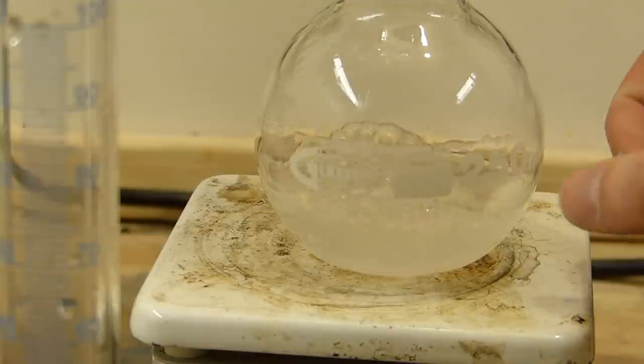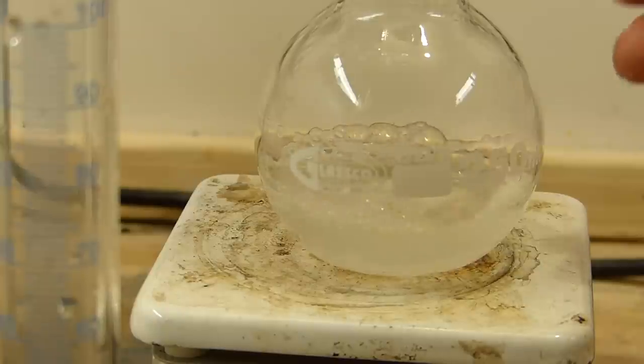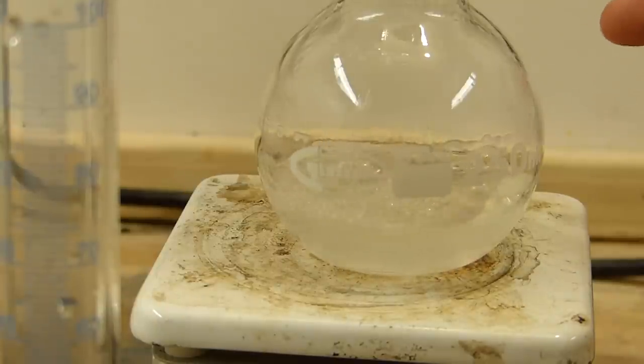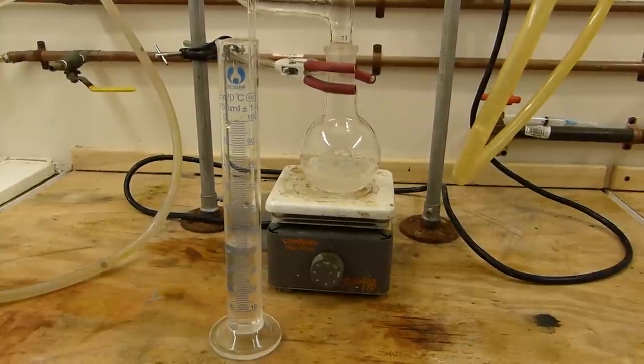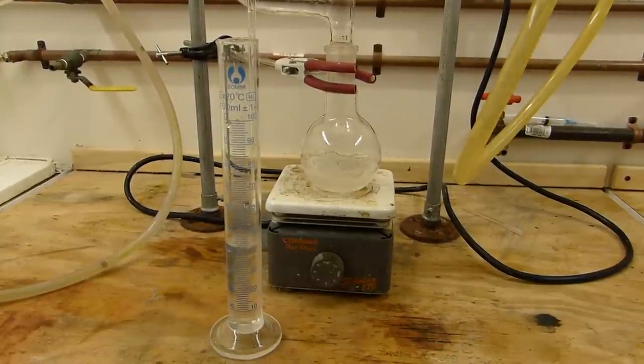This reaction here is designed, you can scale it up to pretty much any scale, and it doesn't foam, and also clean up is super easy.